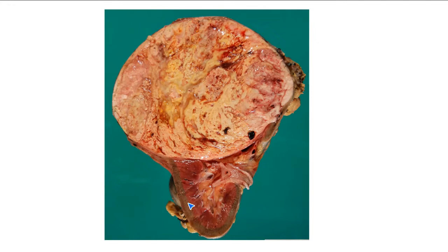cortex, and then after the cortex there's the medulla, and then what do we have that's going to converge into the ureter? Right, so we have the pelvic calyceal system. So what epithelium lines the renal pelvis and the calyces? It's the same epithelium that continues into the ureter and down into the bladder. What epithelium is that?